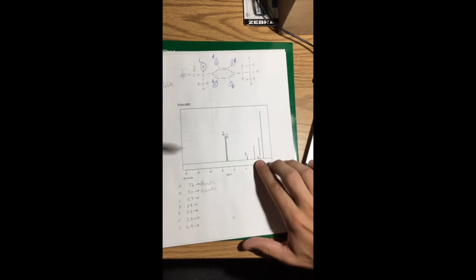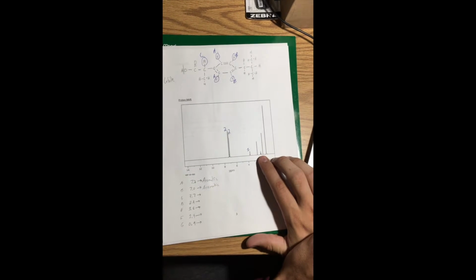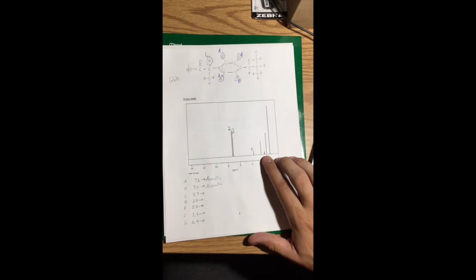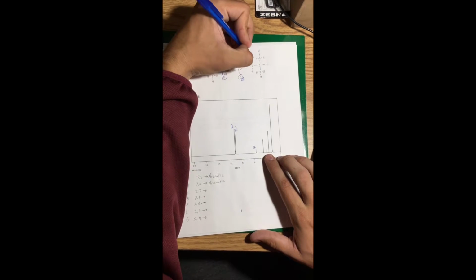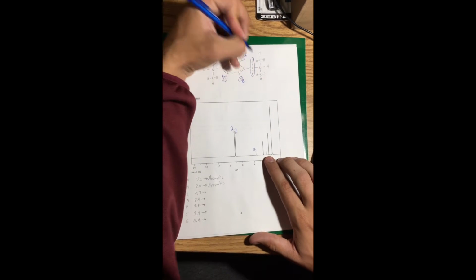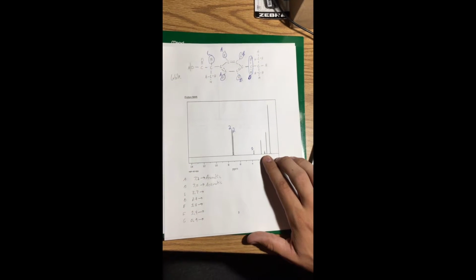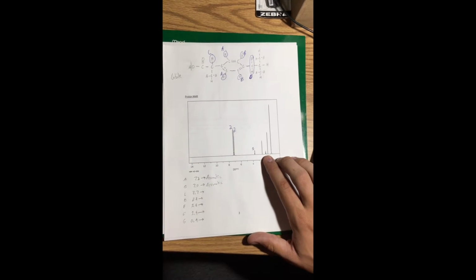You can see that on this chart it applies for a secondary alkyl, which right here is featured in a secondary alkyl, so I'll circle that whole molecule, but it will only reference the H's. Label that D. And then again, I'll write a number 2 down here.